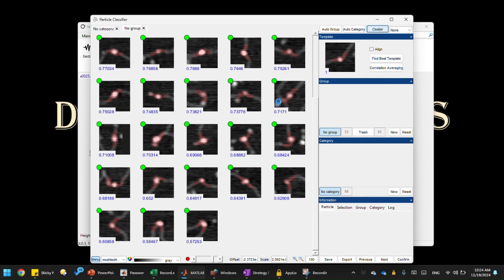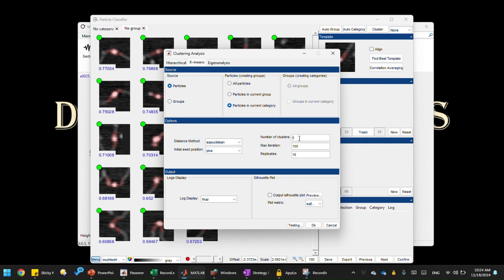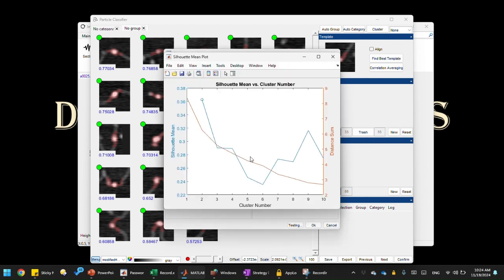Let's click cluster. We are going to use k-means for now because that's easier to understand. We're going to do some testing and see what's the optimal parameter we should use. We're going to sweep the parameter from 1 to 10 cluster number and see which cluster number gives us the best results. It should give us a silhouette plot like this. So we can see 9, and maybe 4 and 3. We need to use a local maxima as our cluster number.